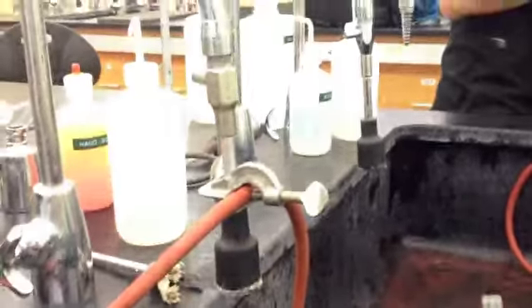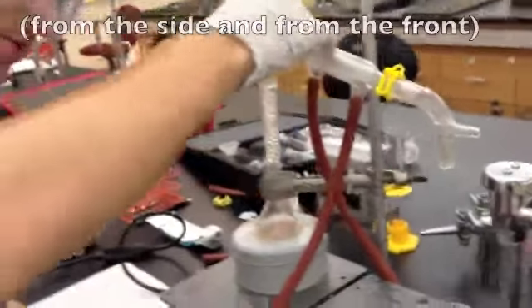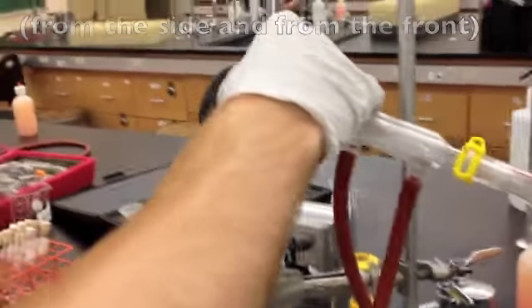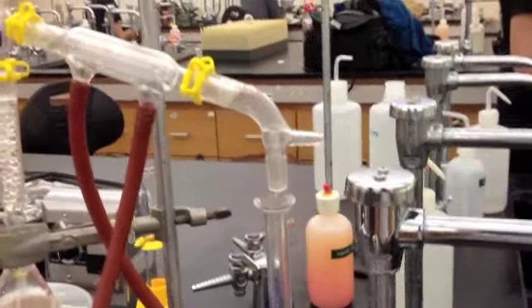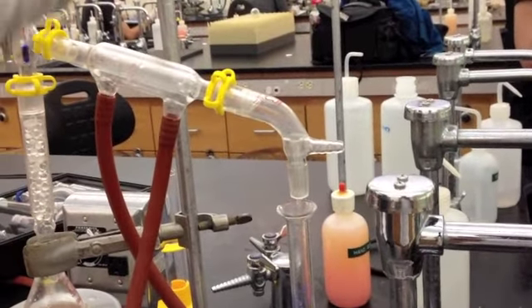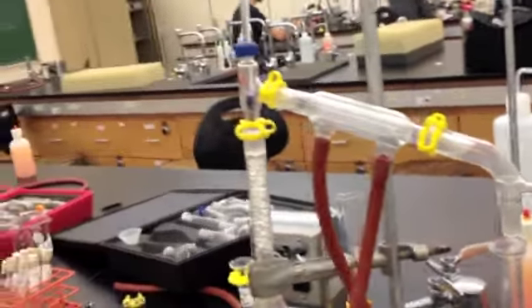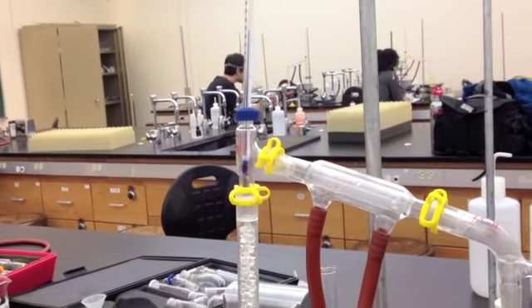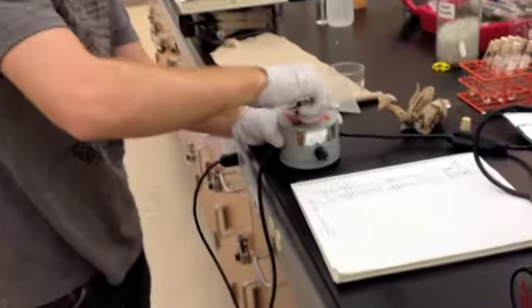Now, after making sure your apparatus is straight on all cross sections, make sure your graduated cylinder is in place, and you're ready to run the distillation. When you're running the distillation, you want to turn the variac on at a very low heat setting.